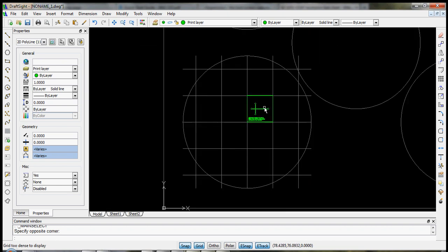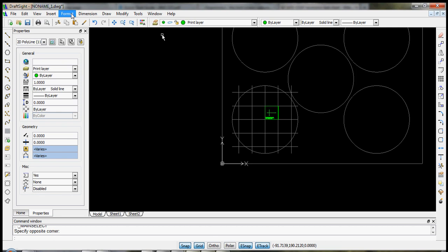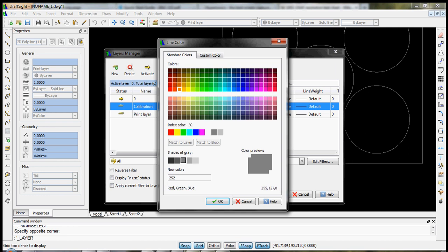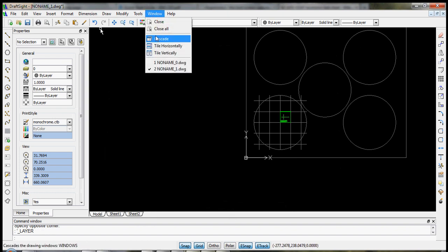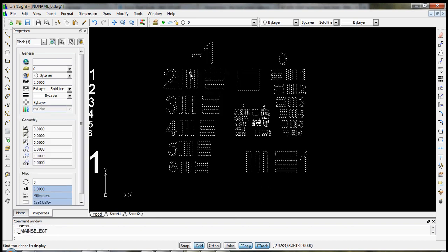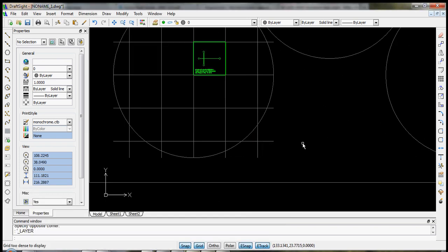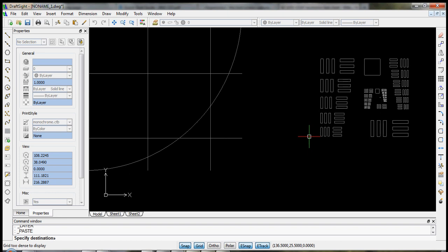And we're all set. Now before we finish, since we have already made our test pattern, why don't we copy that over? And just for some more practice, let's make a new layer. Let's call it calibration. Let's make it a different color. How about orange? Okay, and now let's go to our pattern. We'll copy that, just Control C. We'll move to our drawing. We will just say Control V, paste. And now we can find a place to put it. Let's just put it down at the bottom.